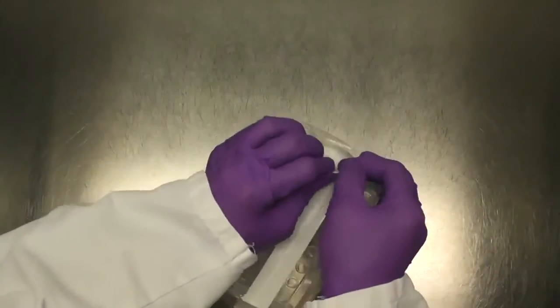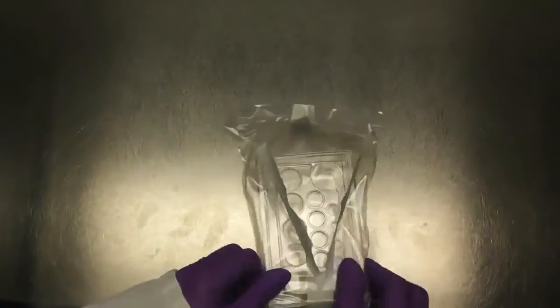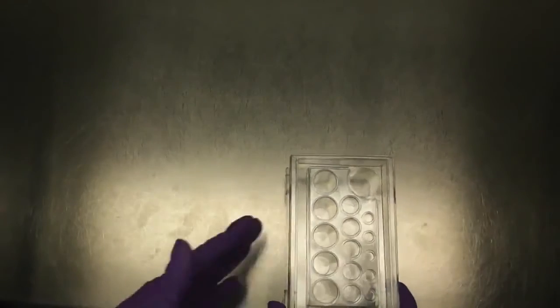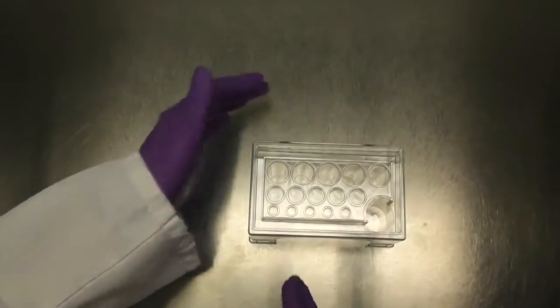To use the IMPN plate, first open the aseptic packaging, being careful not to touch the top of the plate or the insides of the wells. Place the plate on a level surface with the larger overflow well closest to you.